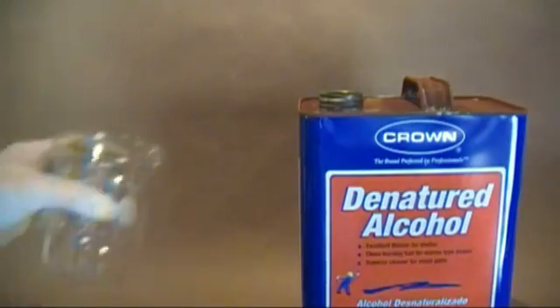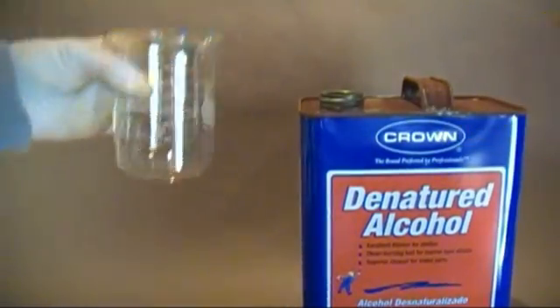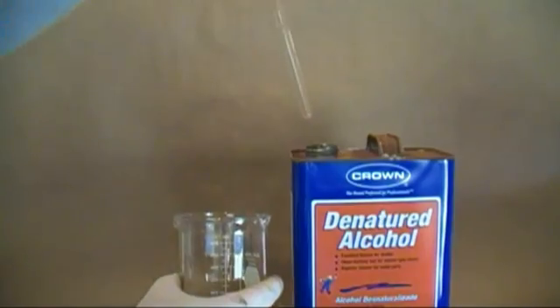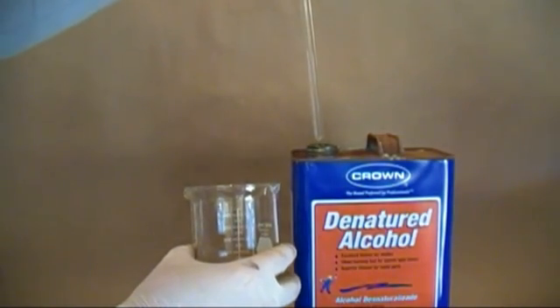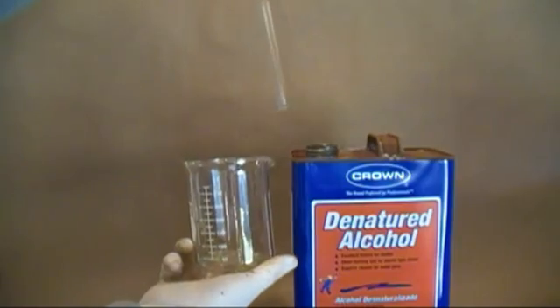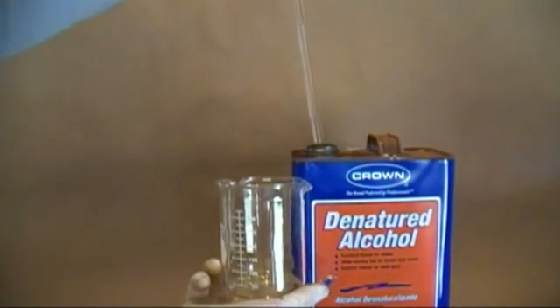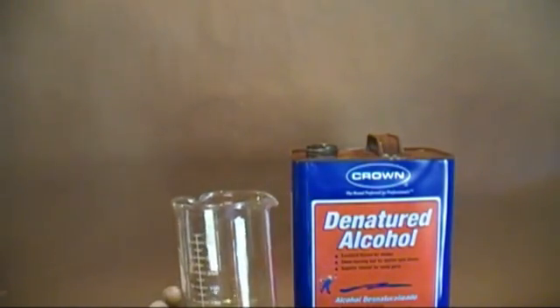I'm pretty sure the people who designed these cans designed them so it was impossible not to spill whatever solvent they were holding everywhere when you try to pour them. An easy solution is to use a glass tube and use the straw method. Place the glass tube in the solvent, place your thumb over the open end making an airtight seal, then lift the tube plus solvent out. Once the tube is over the desired container, pull your thumb away from the opening. The solution will pour out the other end. No mess, no fuss — repeat until you have the desired amount.